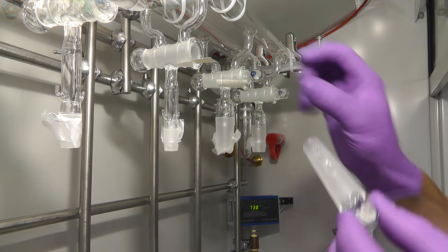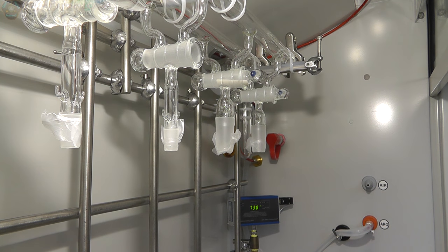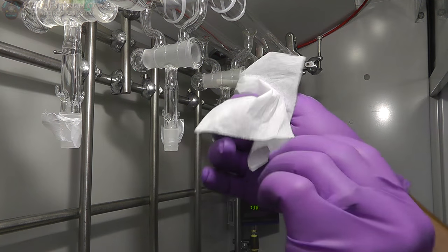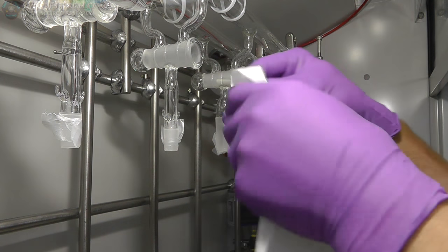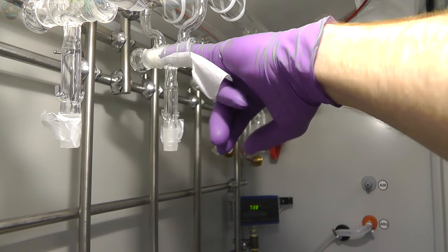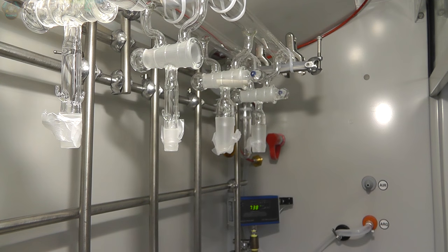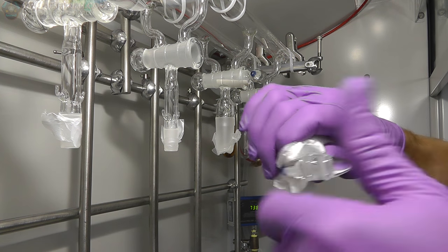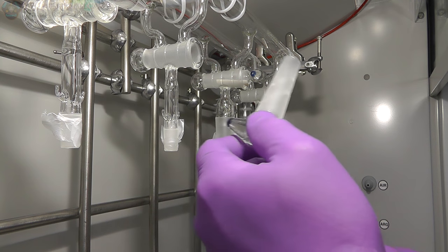So when they ship these, they put a little piece of paper in here so that these don't get jammed in there and smash them. So I'm going to wipe this off. Make sure there's no contaminants on here. Same thing with this, the best I can. It's pretty good. Now, right now you can see this is actually frosted, but here in a second you'll actually be able to see it's clear.